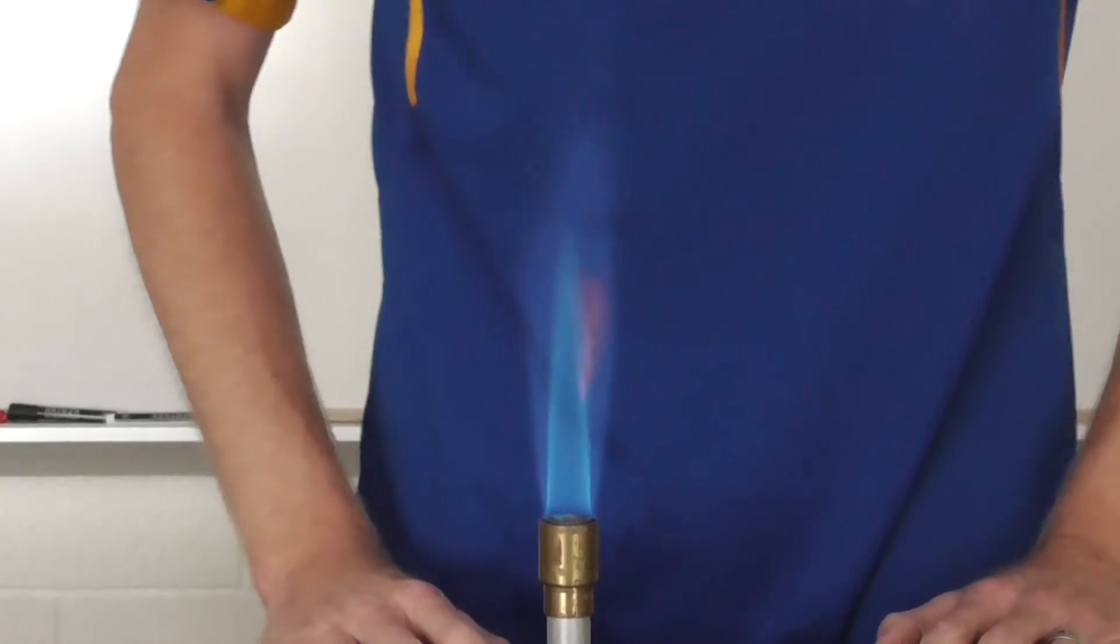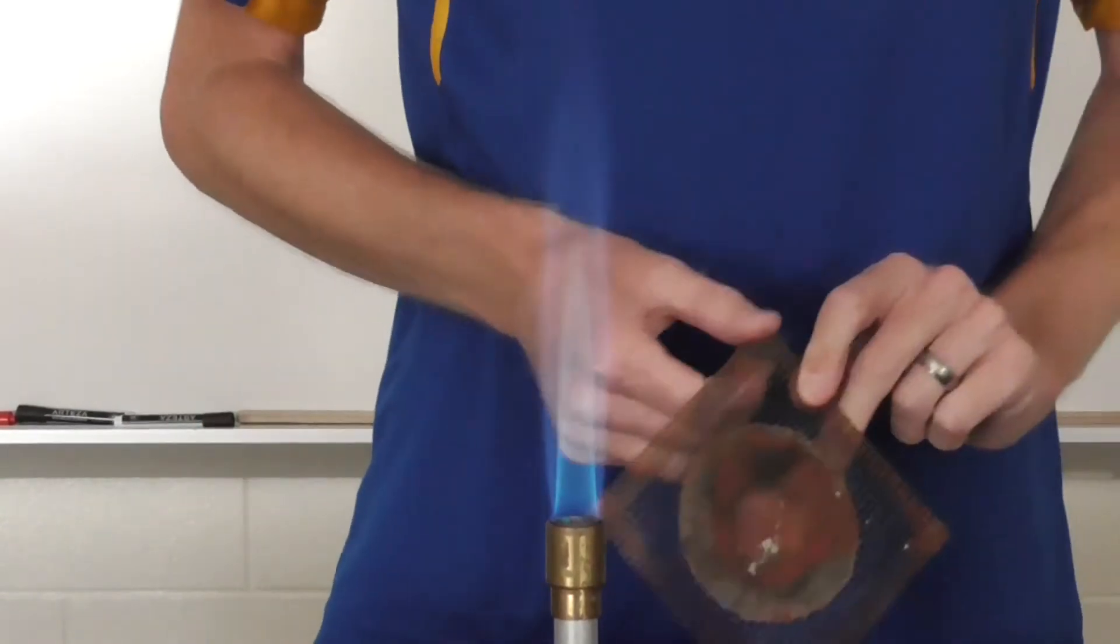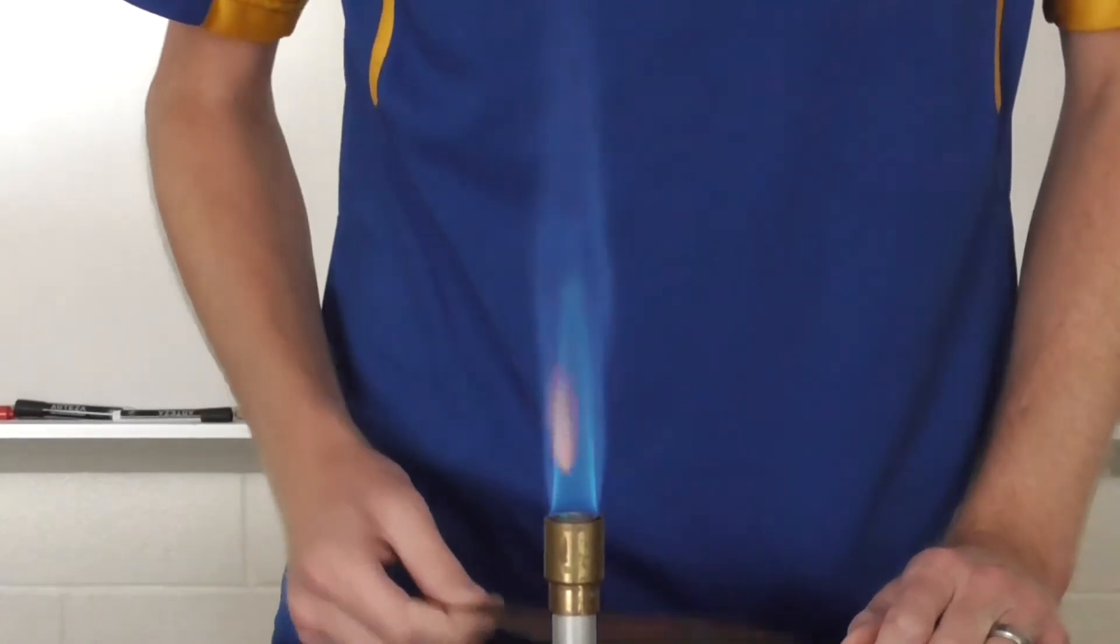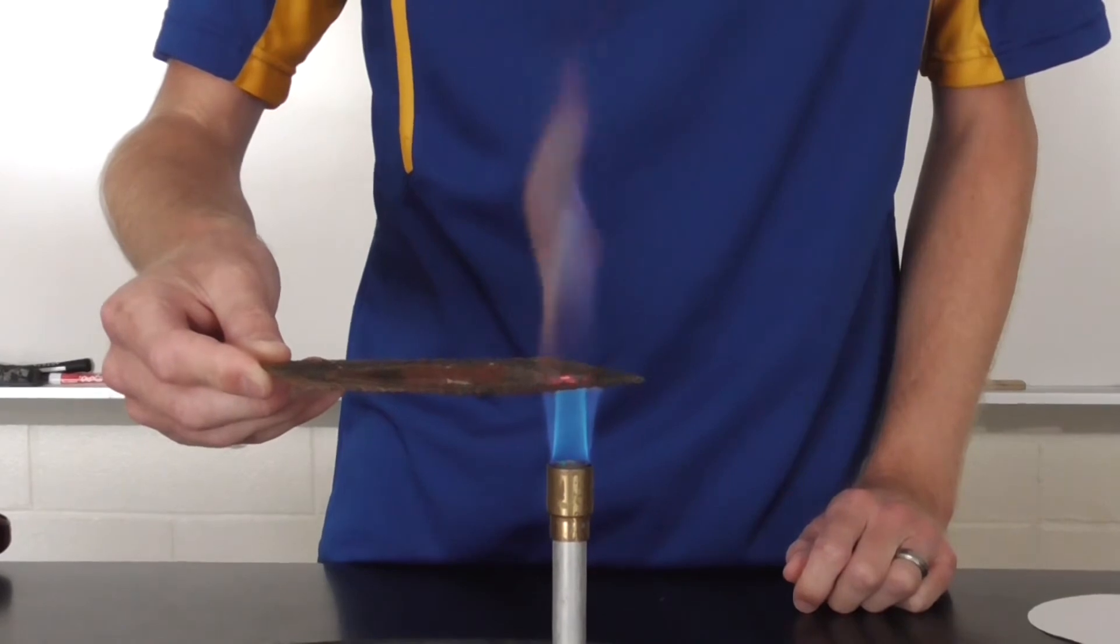So this is the type of flame you'll be shooting for in most every lab. Now it should be noted that the hottest part of this flame is not down here. Many students think that's the hottest part, but that is not correct.